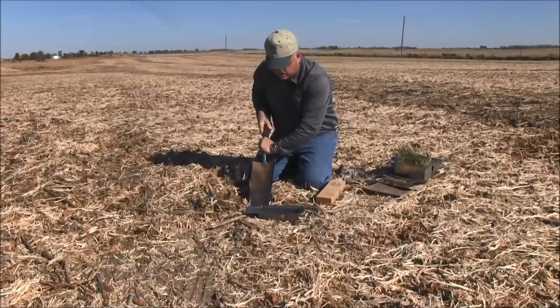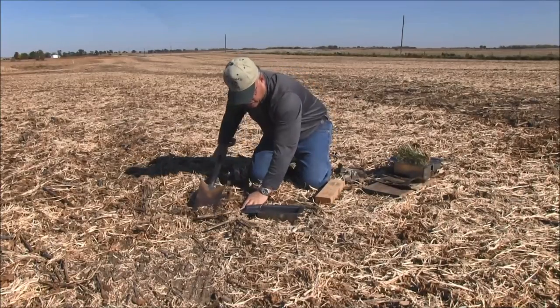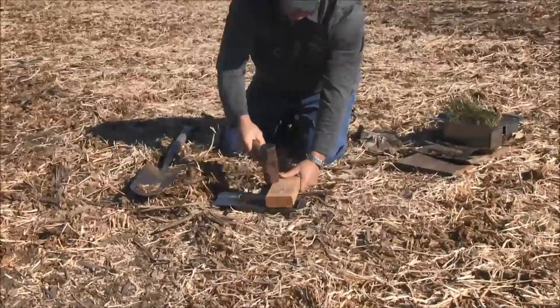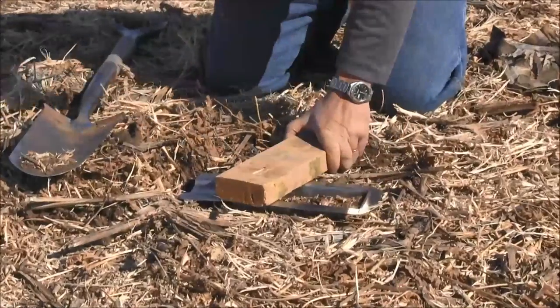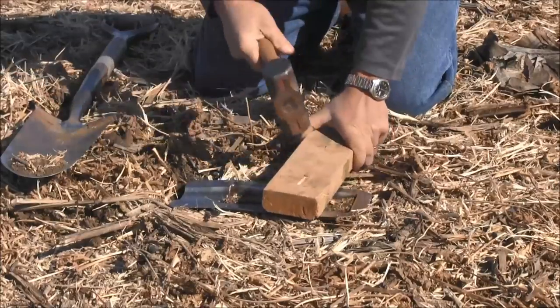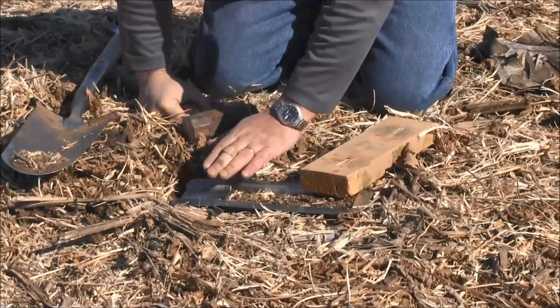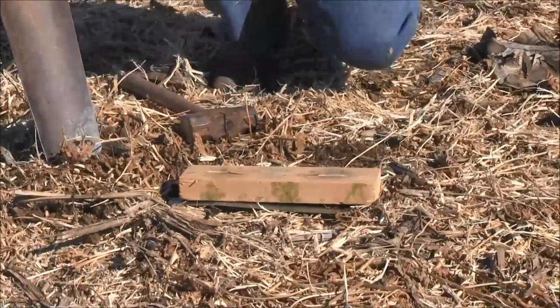Part way in, we want to remove some of that material out in the front so that we're not bending up our funnel out in the front. Then we're going to continue to drive in that cutter. Drive it in uniformly down until the soil surface is actually at the front of that funnel — even with the front of that funnel. And then we're going to actually remove that sample and try to keep the material in it.